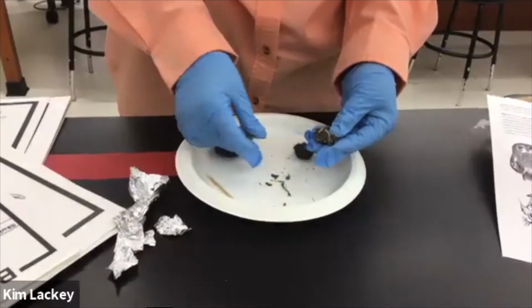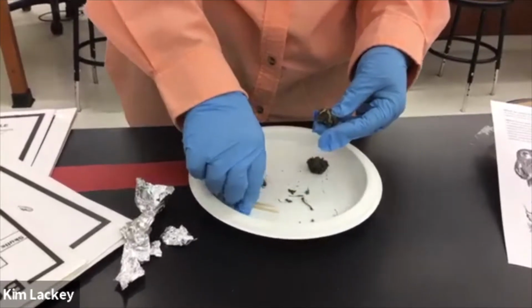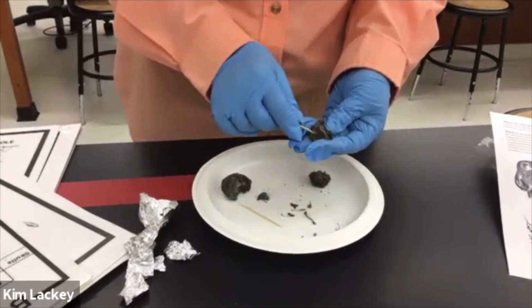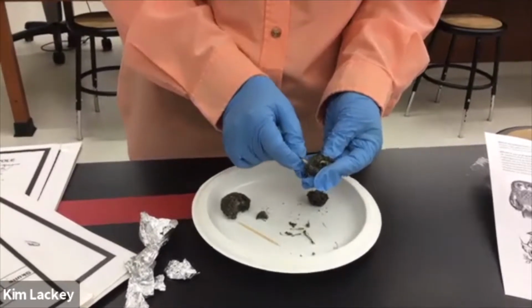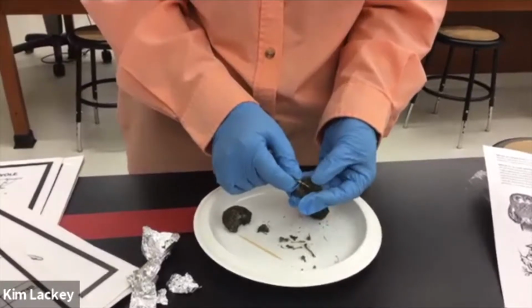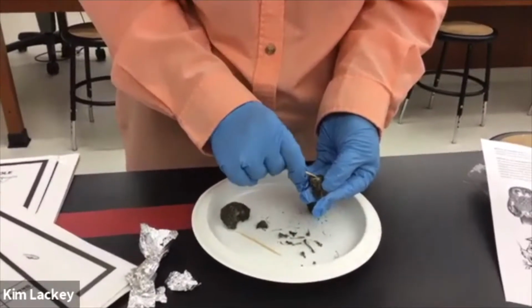Okay, so there's lots of different bones in here. So here's a little rib bone. You can tell by its curve. Use your toothpicks, which are sharp, so you don't want to force it, but sometimes these get to be very tightly packed together, so it can help tease apart some of these really tight areas. And I thought I saw, yeah, here's a jawbone in here.